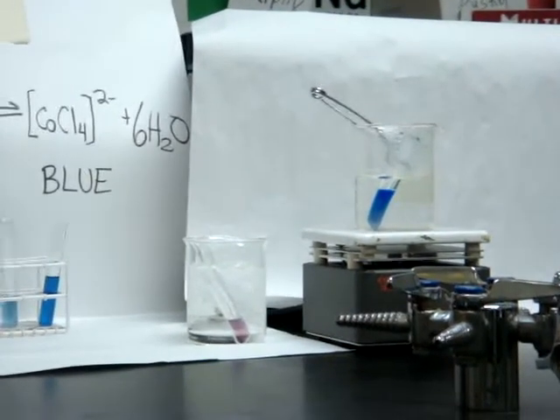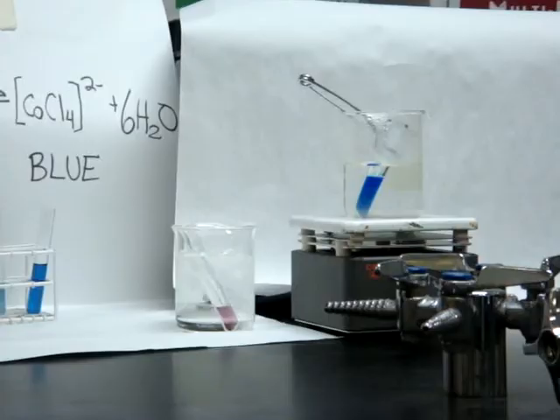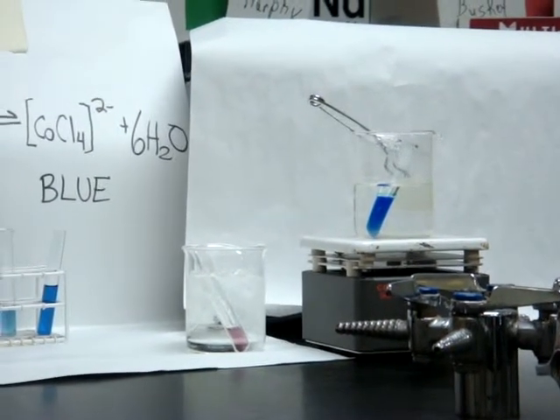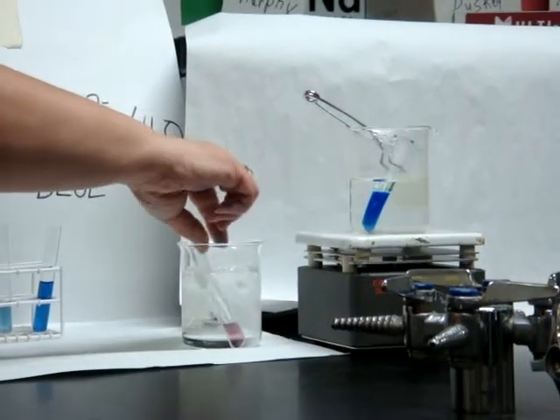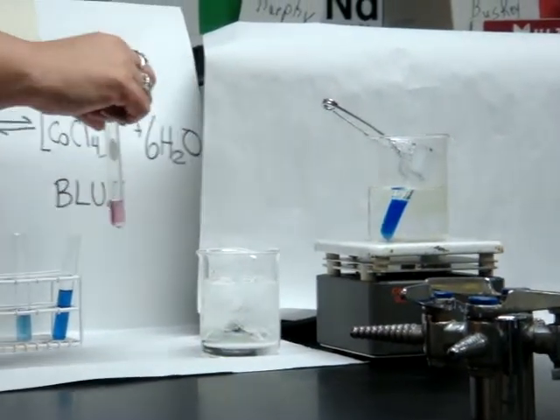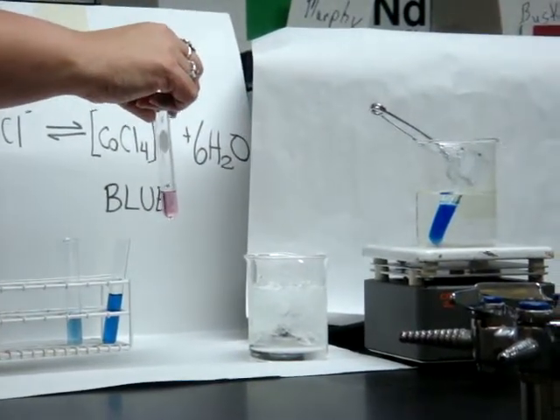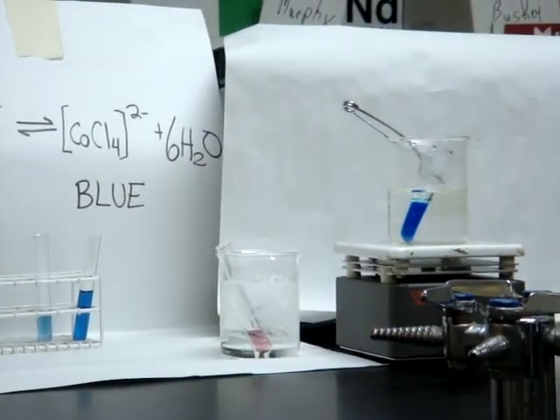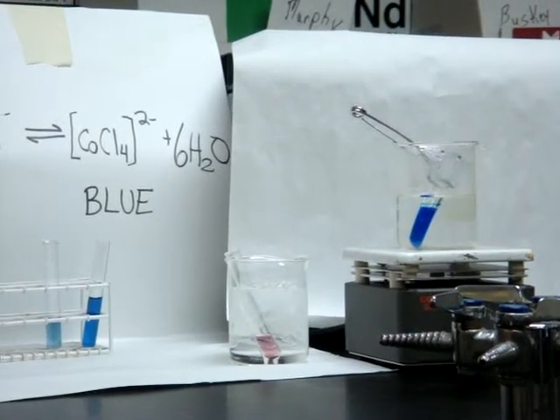Whoa. So the heat has made it turn really, really blue. And if you look at the ice water, it's turned really, really pink. Now, your job is to figure out why.